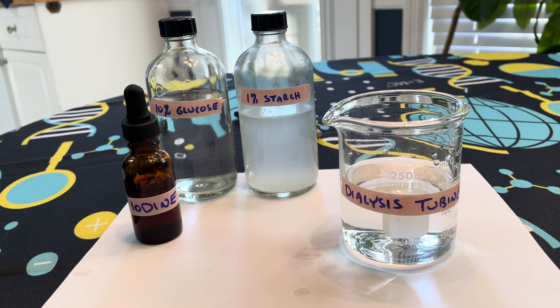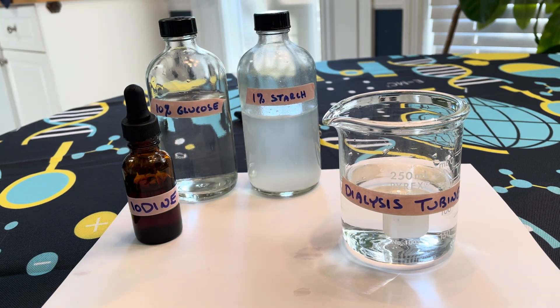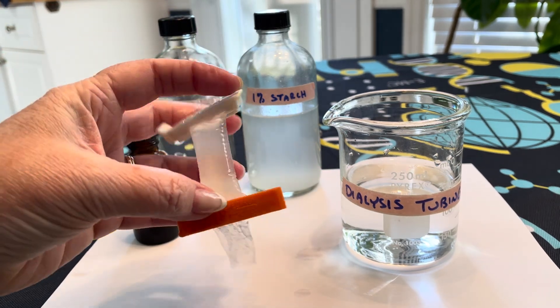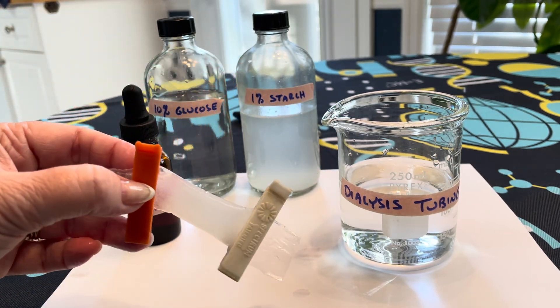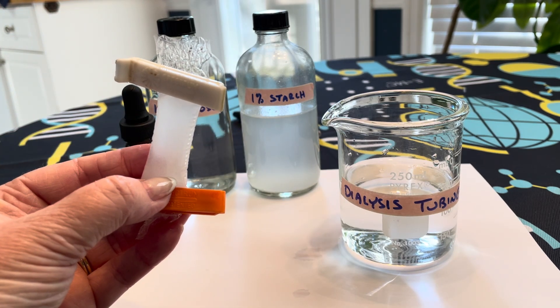So what we're going to do is set up this experiment. It says to put a little bit of glucose and a little bit of starch solution inside a dialysis sack and clip off the ends — I've already gone ahead and done that in advance. So what we see is one of these dialysis sacks with the ends clipped off. It says to note the color of the dialysis sack — it's kind of a milky or cloudy white as we start this experiment.